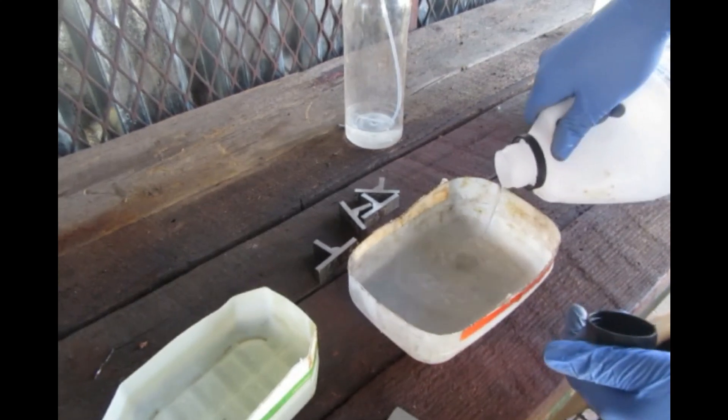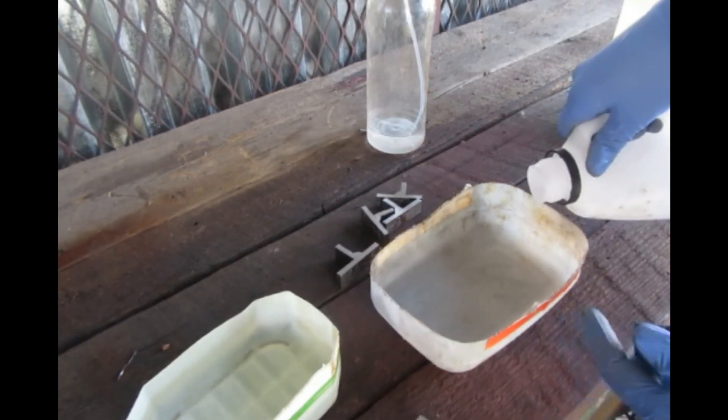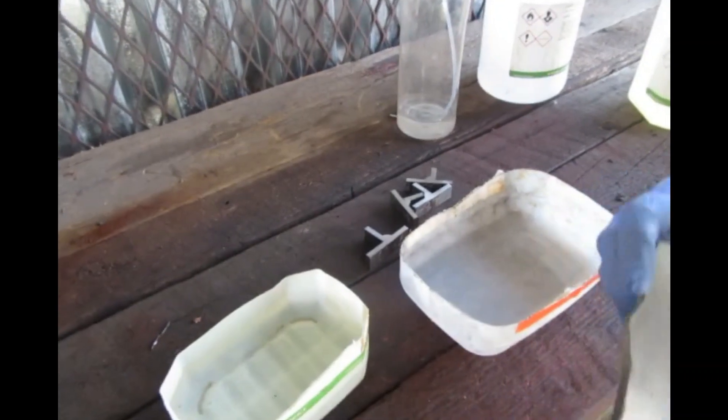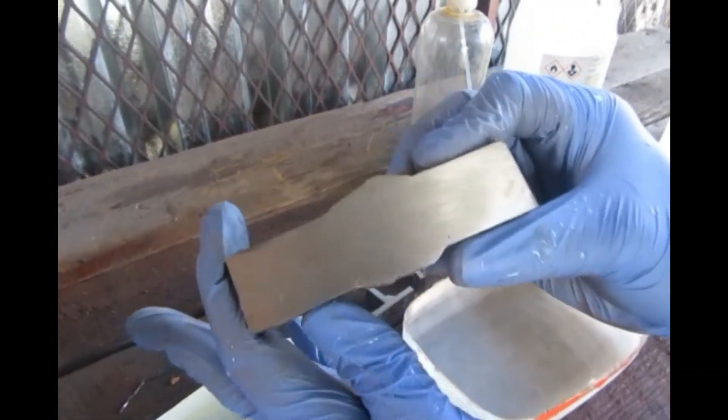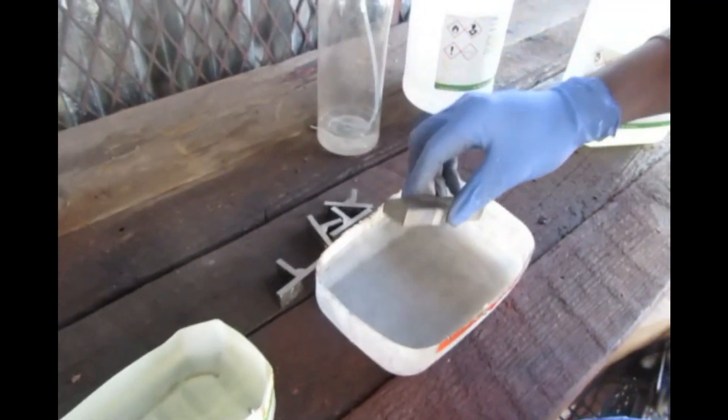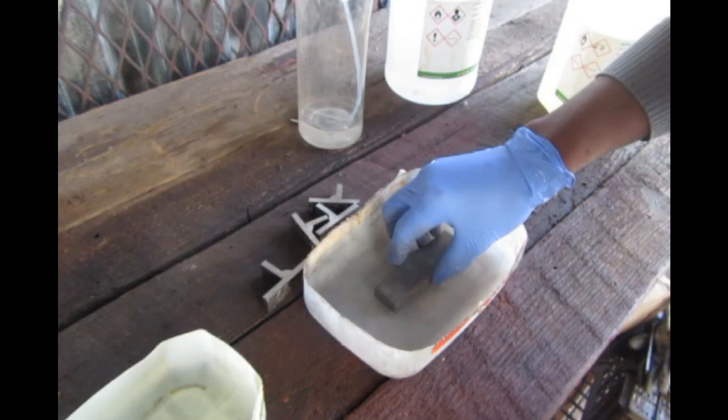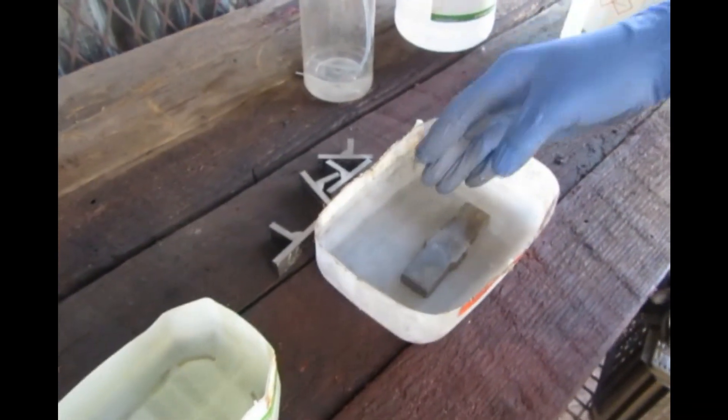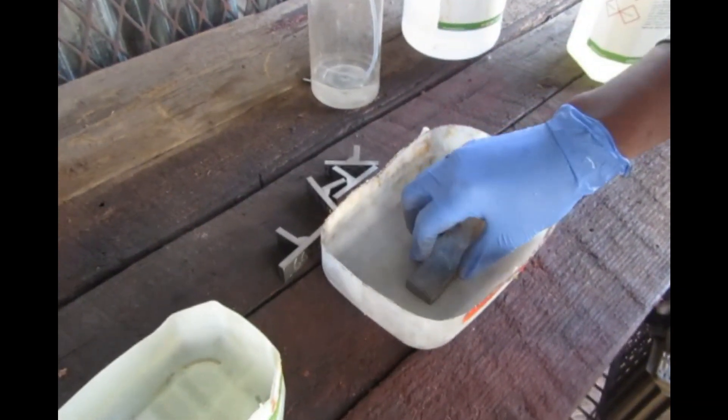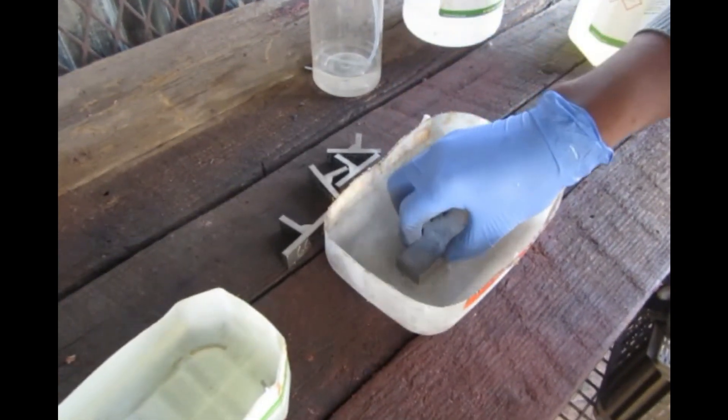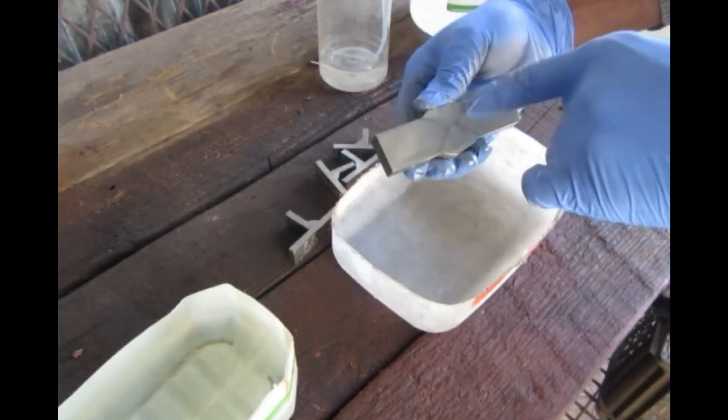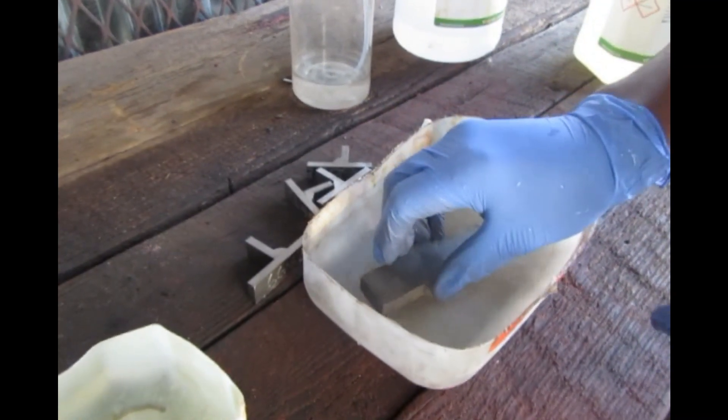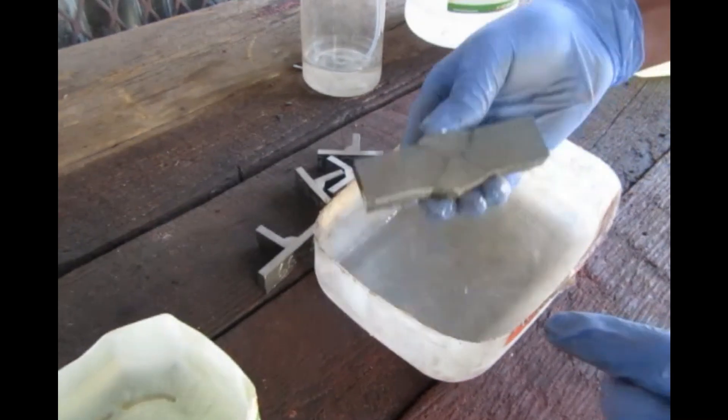I prefer to use some tools for measurements, but the main mission here is to show you how the weld looks like. Can you see that, how it looks? I can leave it for a while if I want, but it's not necessary. After about one minute, the weld will be revealed. You can see now the weld is coming out.